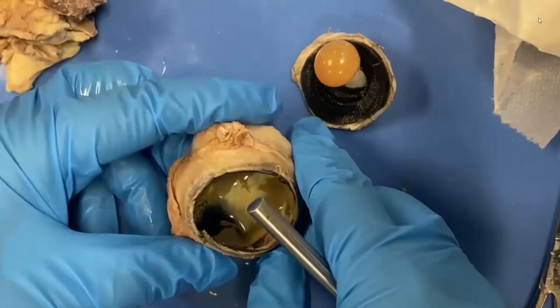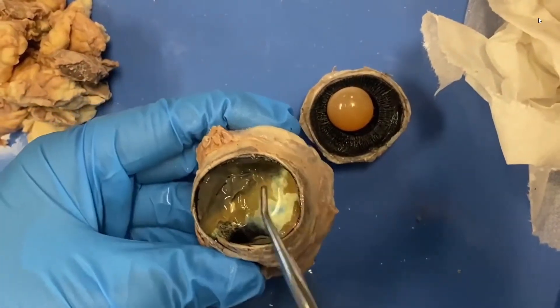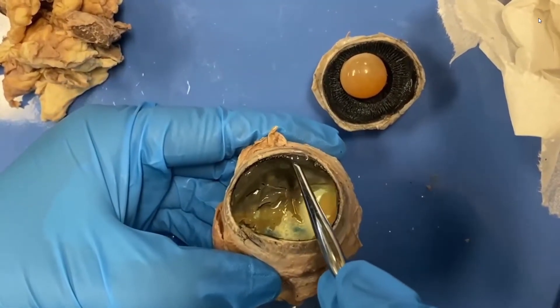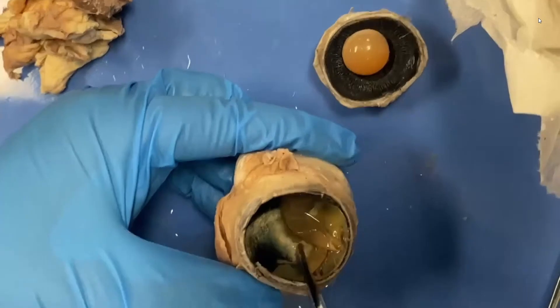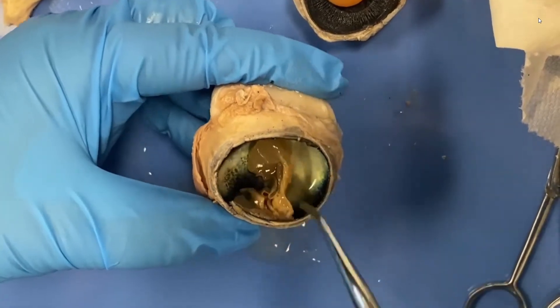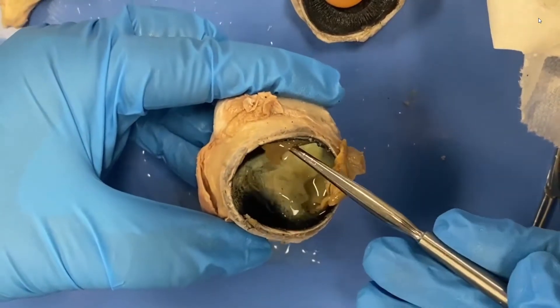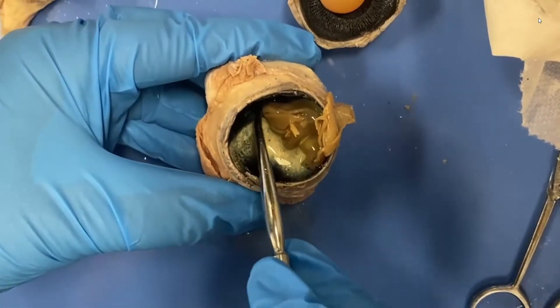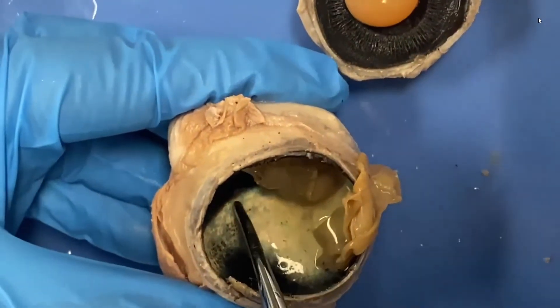So let's move to the posterior cavity. We'll get rid of some of that fluid with a paper towel. My retina became a little bit detached when I cut the eye open, but the retina is the internal layer — that is this beige layer right here. If I scoop up that entire beige layer, the retina has all your photoreceptors. There are two photoreceptors — you can name those two. All those fibers that make up this whole retina exit the eye on the posterior side right there. This structure where they exit is called the optic disc, and in your vision it's known as a blind spot.